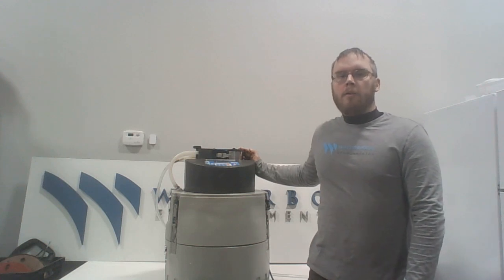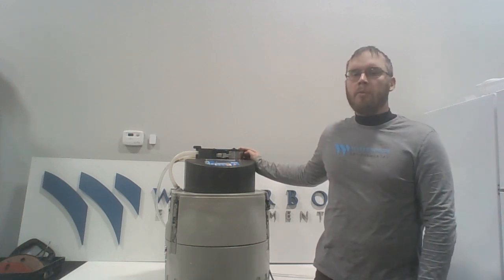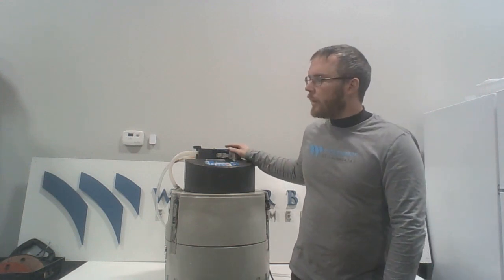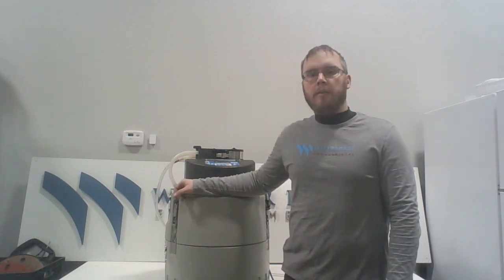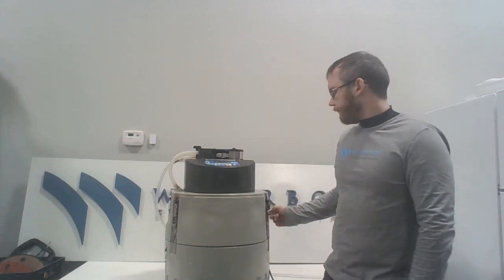Once we've assessed that condition, we then look inside the autosampler housing and we verify that the rollers inside will not damage the intake line during sampling and that there aren't any pinch points within the housing itself. And we follow that through and look at the connection where the intake line meets the base and make sure that's still tight and secure.